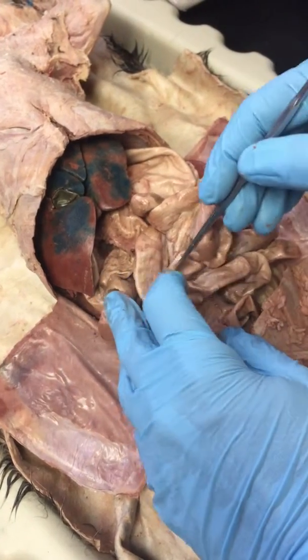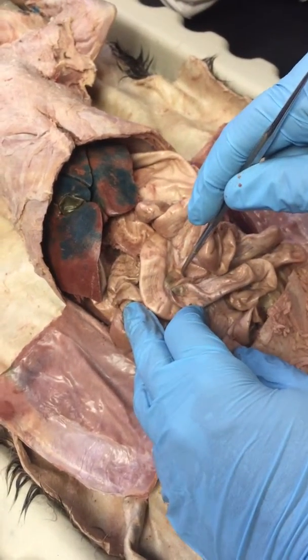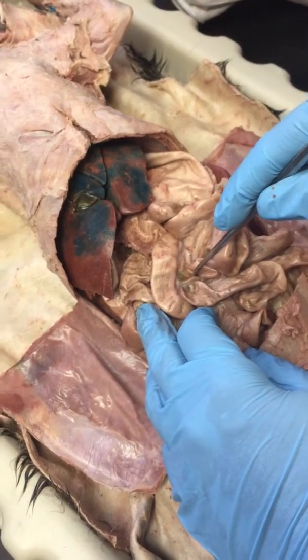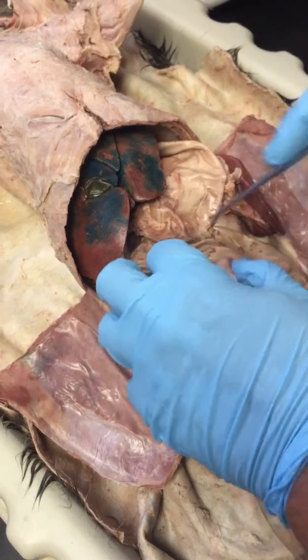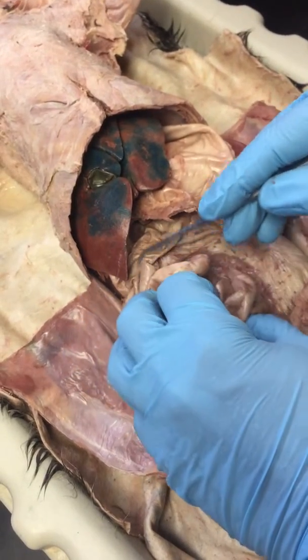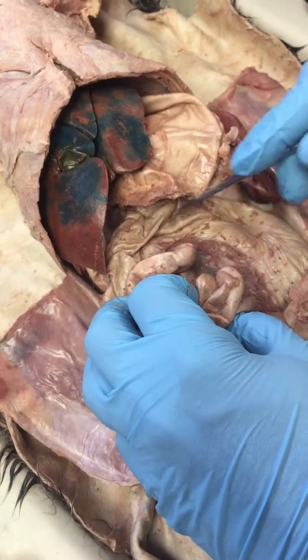If I stick a pin right here, you're going to assume that I'm just going to want the jejunum. Okay, the middle of the small intestine. Okay, and as we pointed out before, pretty obvious that this right here is the large intestine.